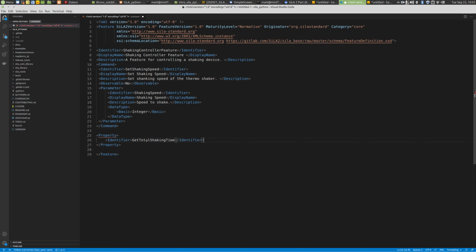Okay. Then a display name, similar here, get total shaking time, and a description: get the total shaking time of the thermo shaker since it was installed, for example. Okay, and then again we need to say if this property is observable, yes or no.